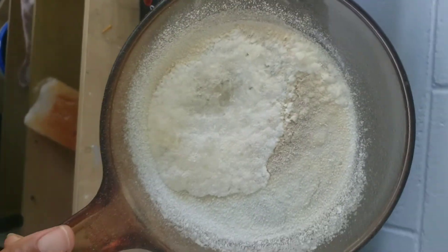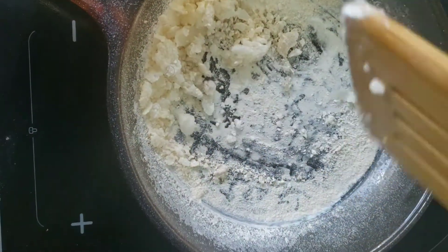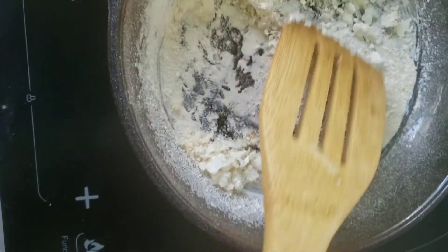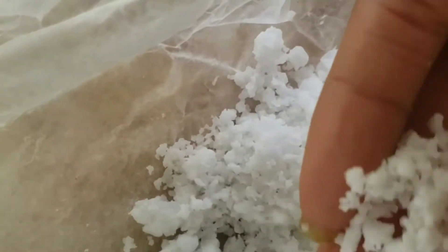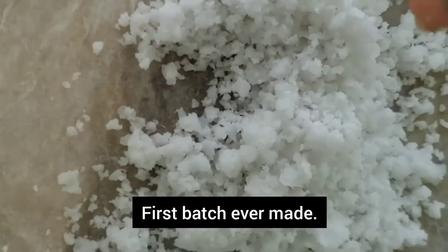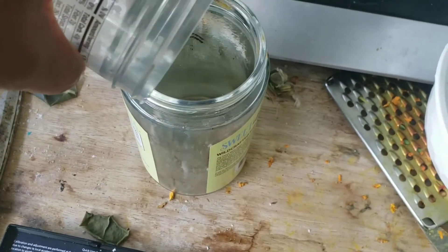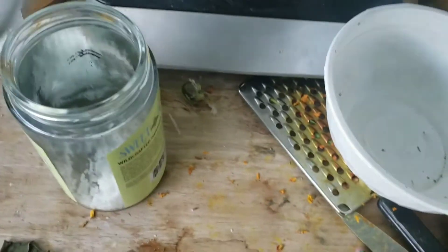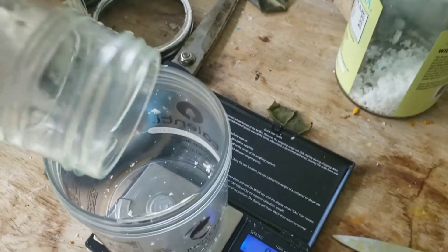There it is completed. I'm just going to scrape it up now. The very first time I did it, which was my best result, it was a little bit wet and the instructions said to put it on a coffee filter and let the water absorb. This one was pretty dry when I took it off. Right here I'm just going to combine it with the potassium aluminum sulfate in order to make aluminum acetate.